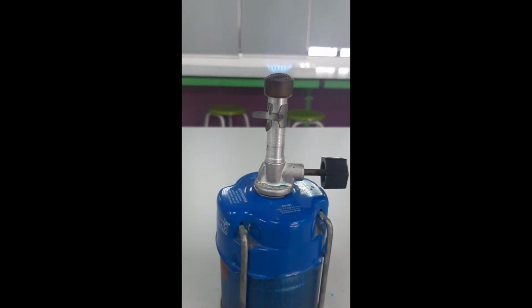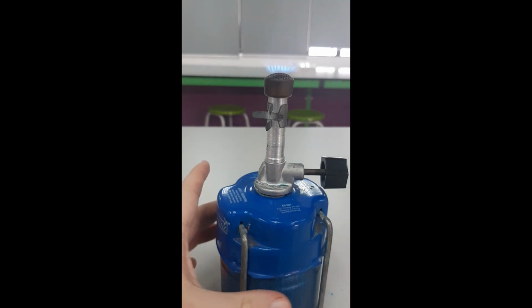The white solid that you could see there is anhydrous copper 2 sulfate. So that's without the water. So this is a hydrated salt that is blue color when hydrated and white color when anhydrous, or when the water has been removed. So that is a common experiment. It's used to test for the presence of water. You can use the anhydrous stuff, the white stuff, drop a liquid that you think is water onto it and it will go blue. It's also an example of a reversible reaction. So you can see that there. So lovely white color there.